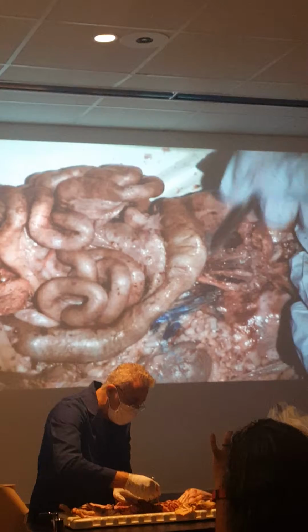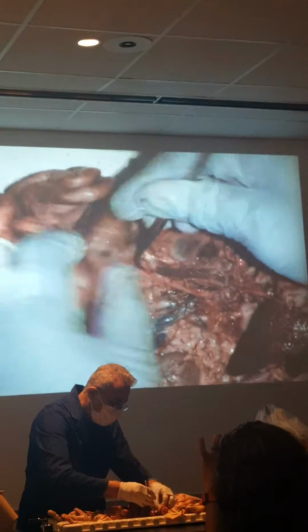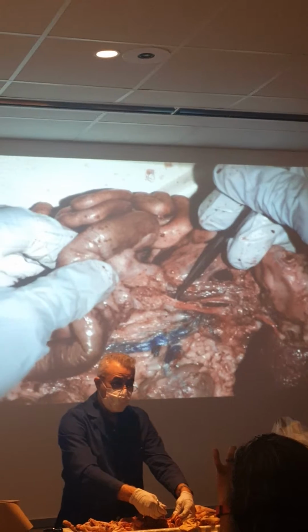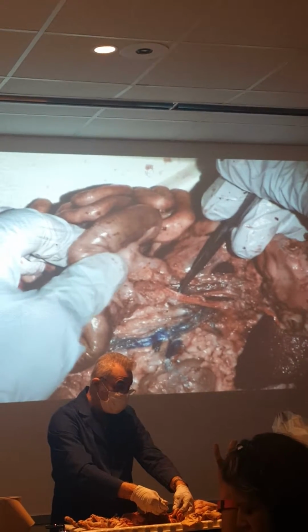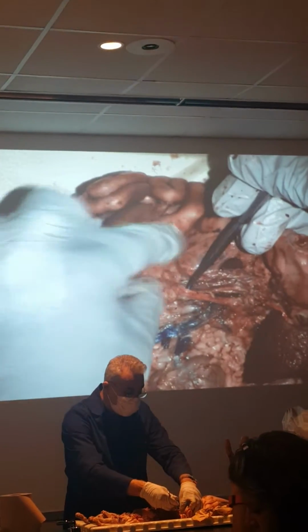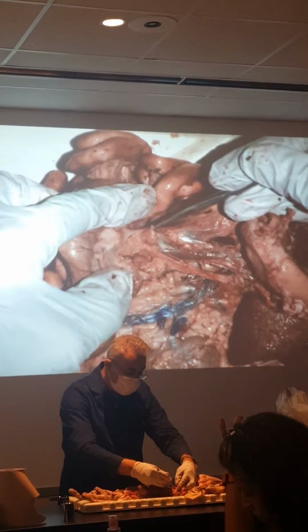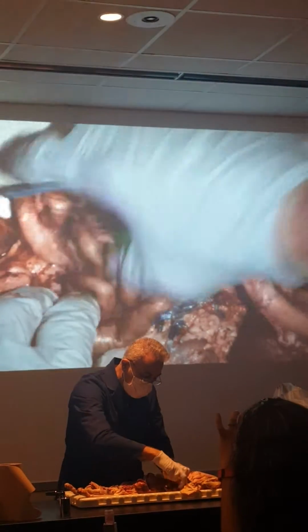Next to that, there's another major blood vessel. If I expose it, you can see, where is it going, guys? Very good. Intestinal. Okay? So it goes to the large intestine, small intestine. We call it superior mesentery because it goes to the superior mesentery of the small intestine. Okay? So let's keep going.